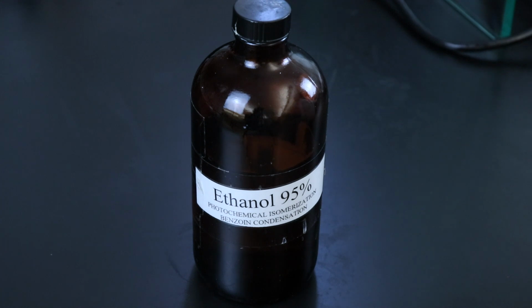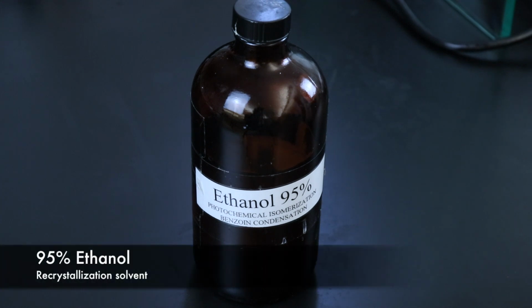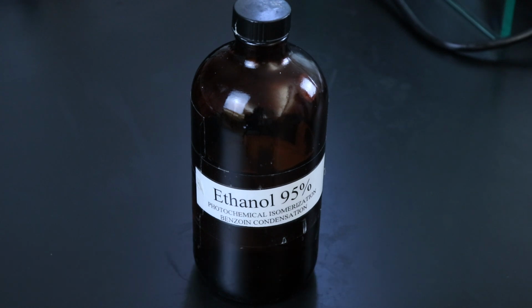In this example, I'll be following the procedure and using 95% ethanol as the recrystallization solvent. And you can do the same. You should follow the procedure in any given lab, dissolving the solid product in whatever solvent it recommends. The general idea with this technique though is to use a solvent which fairly readily dissolves the solid product at higher temperatures, like in a hot water bath, but the product should have a much lower solubility in that solvent at lower temperatures so that it can come out of solution.